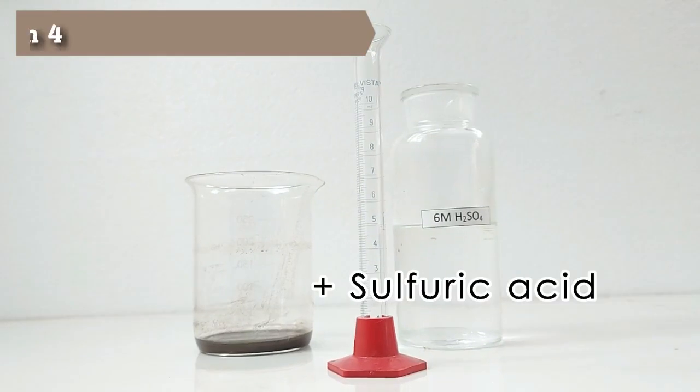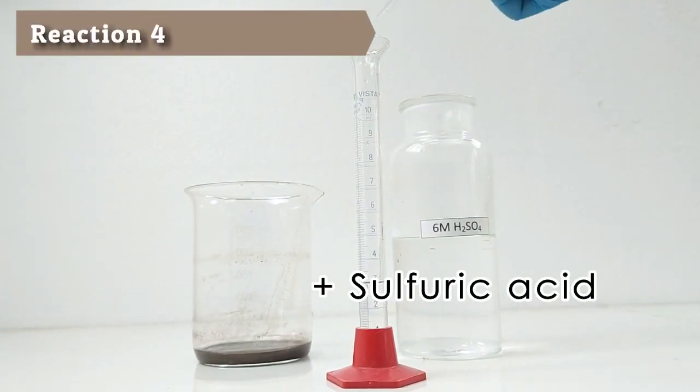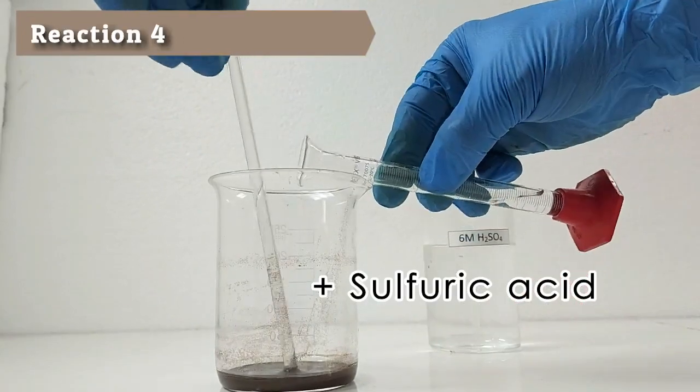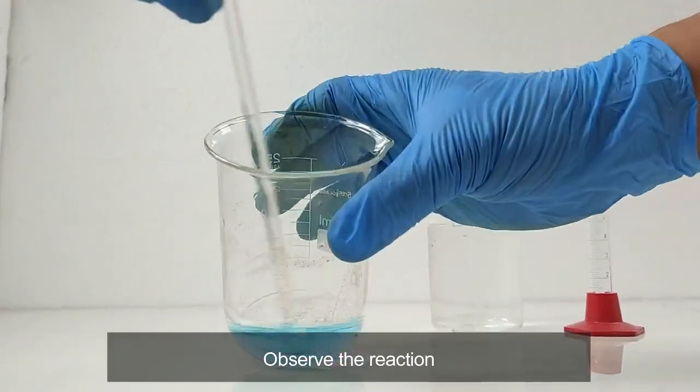Add 3 ml of 6 molarity sulfuric acid while stirring. Record your observations.